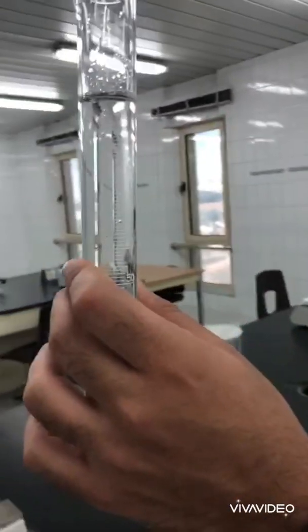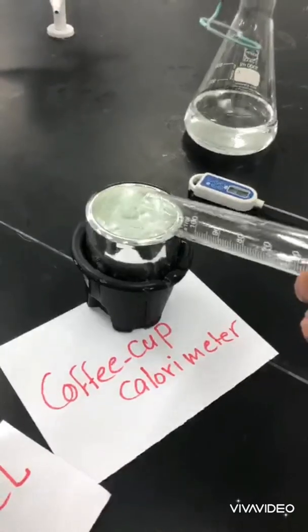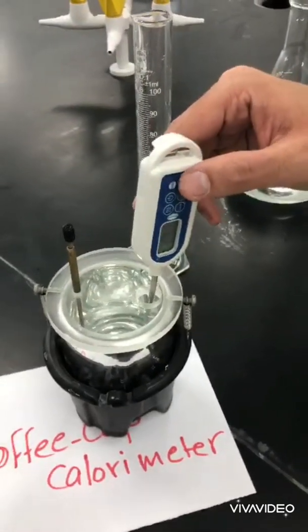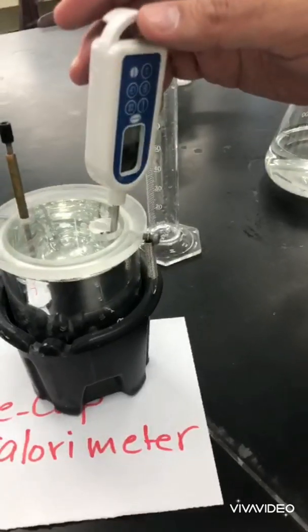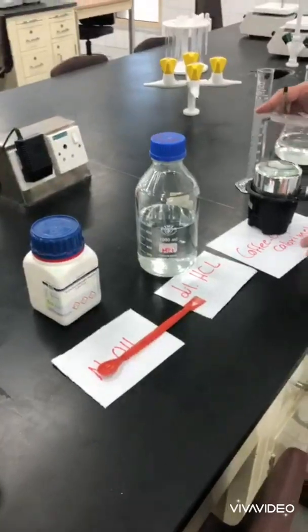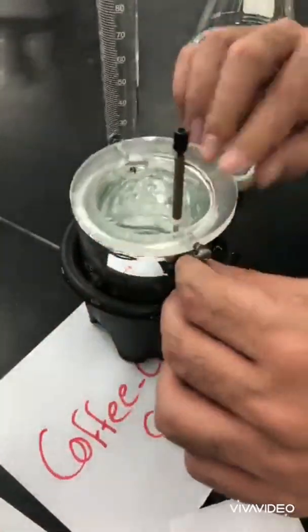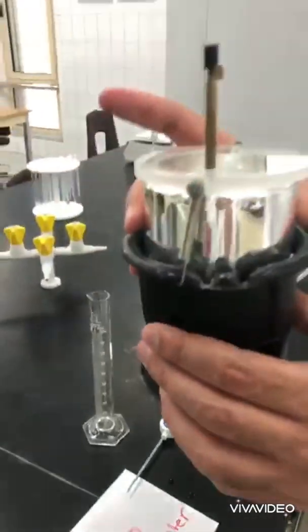It's about 100 milliliters. I'll open the coffee cup calorimeter, then close it. Here is a digital thermometer — just put it inside and record the temperature. The initial temperature is 24.2 degrees Celsius. Now I will take the sodium hydroxide and drop it inside the calorimeter, then immediately close the calorimeter. It should be really closed because this is a closed and isolated system.